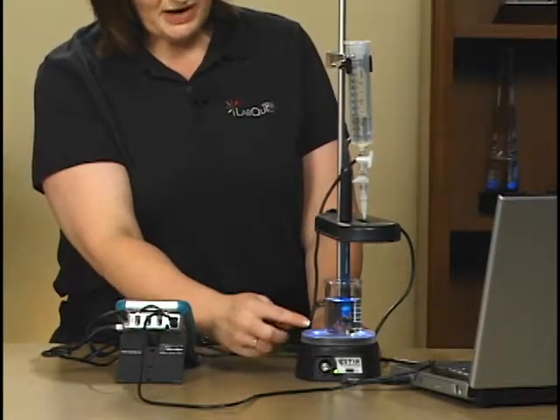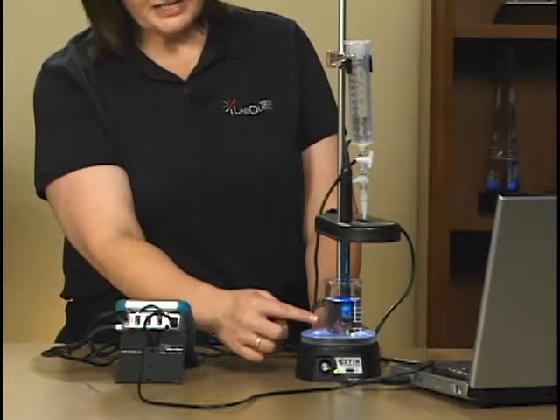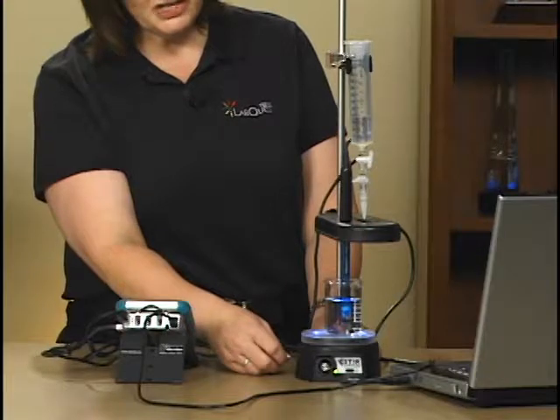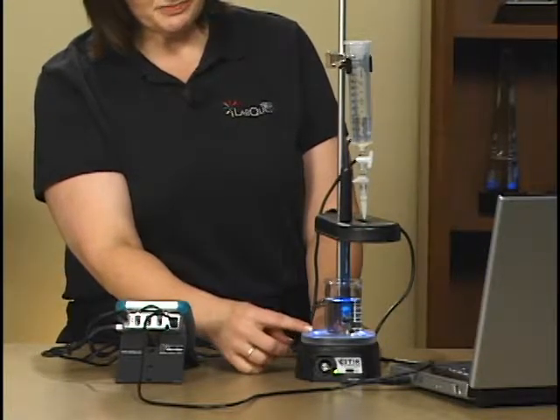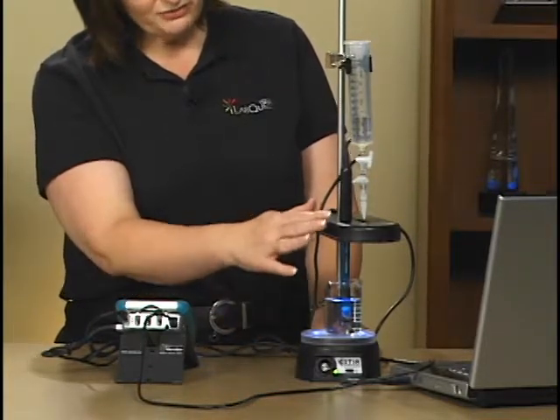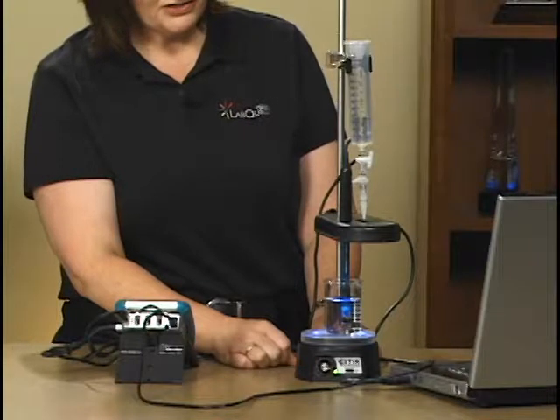The stir station today is powering a little micro stirrer that's a paddle wheel essentially attached to the bottom of the pH sensor, keeping a good flow of the solution going past the glass bulb of the pH sensor. This blue pH sensor going through the drop counter is what's going to be taking the pH of our titration.